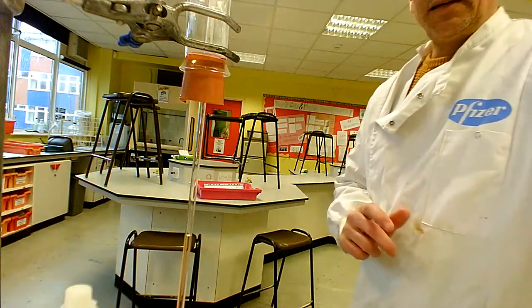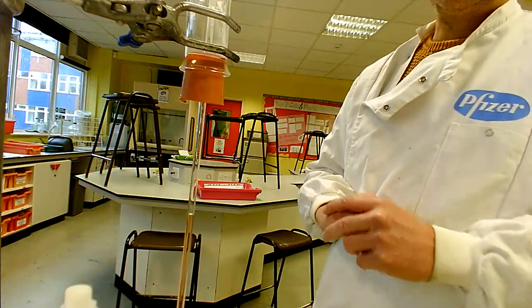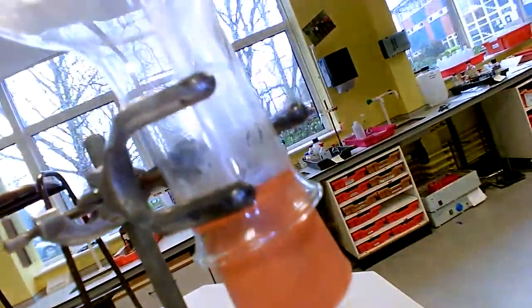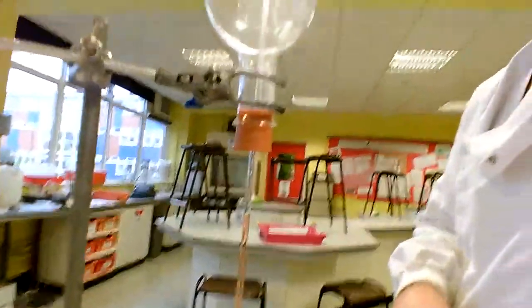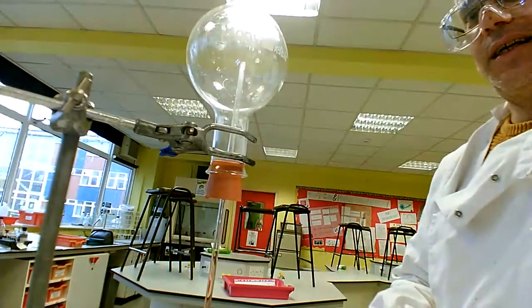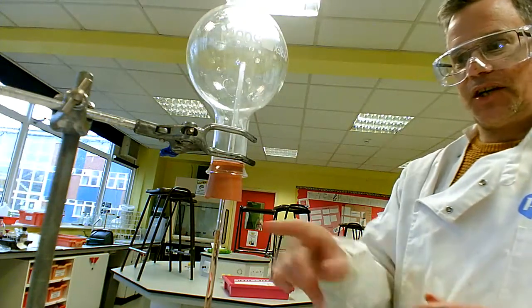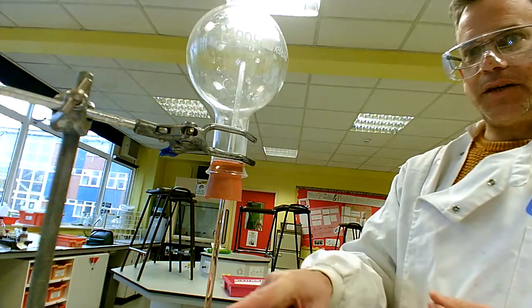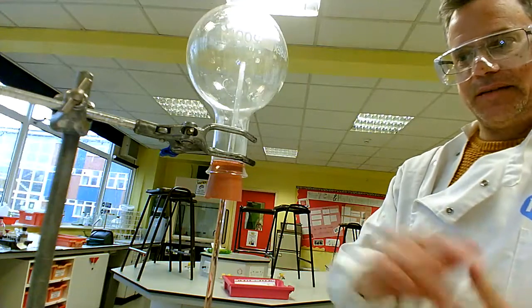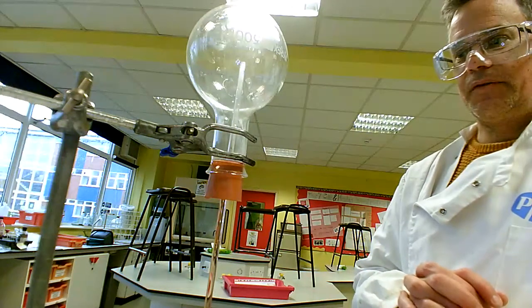We need to consider why, given that it's exposed to the atmosphere here, this water is going upwards. You might also notice that around the neck of the flask is what looks like condensation — that is hydrochloric acid forming from the moisture in the air. The water is very slowly creeping up and it's just about to reach the bottom of the bung, and you will notice that the indicator solution is red. This is linked to one of the two properties of the hydrogen halides that we are interested in for this demonstration.